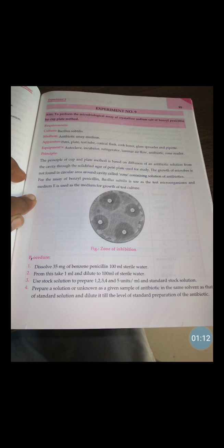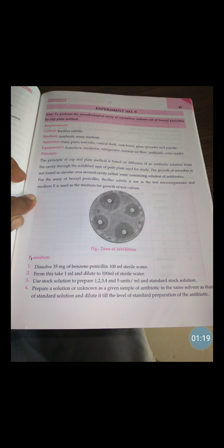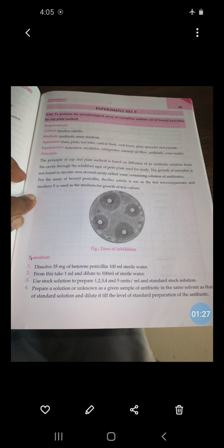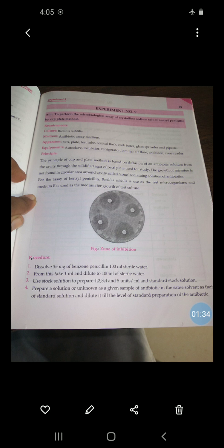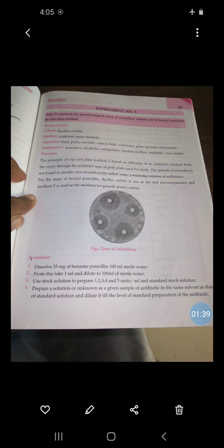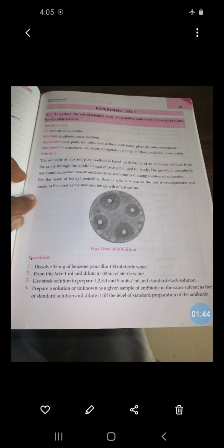The equipment required for this practical includes autoclave, incubator, refrigerator, laminar airflow, antibiotic zone reader.